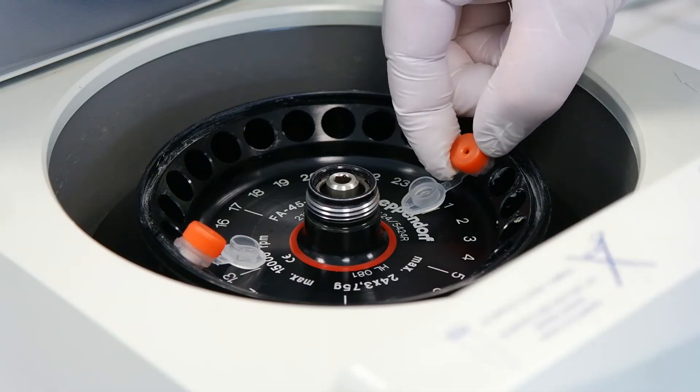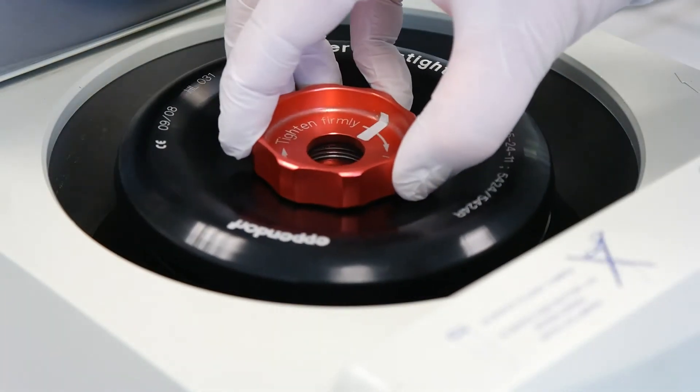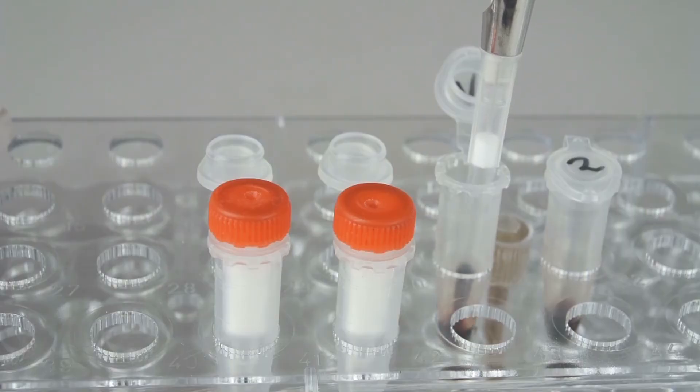You can now condition the column and, after lysis has been completed, load the lysate sample as shown here.